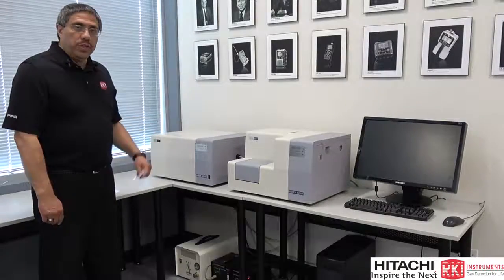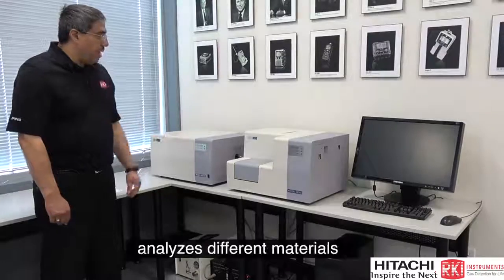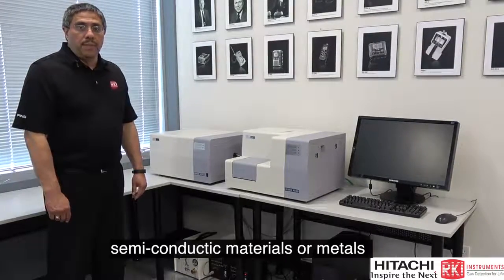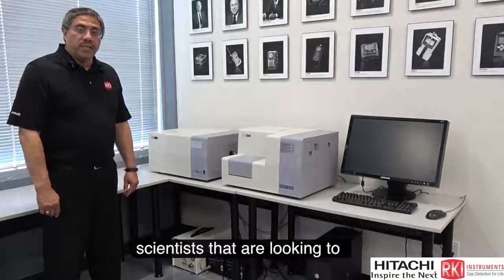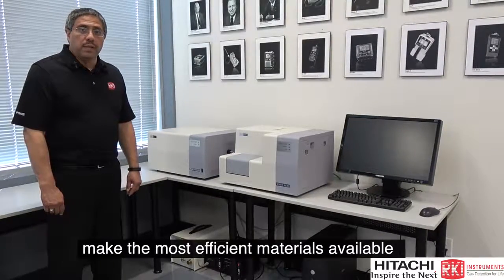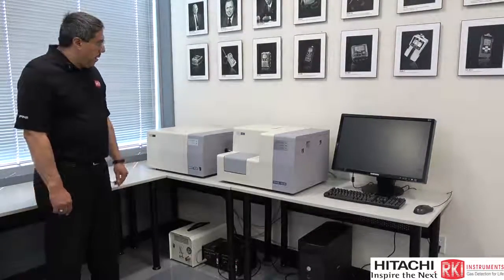Today, I want to show you our AC2 Surface Analyzer, and basically this system analyzes different materials, such as organic materials, semiconductor materials, or metals, for work functions and ionization potentials. Very effective for research scientists that are looking to make the most efficient materials available for today's photovoltaic industry.